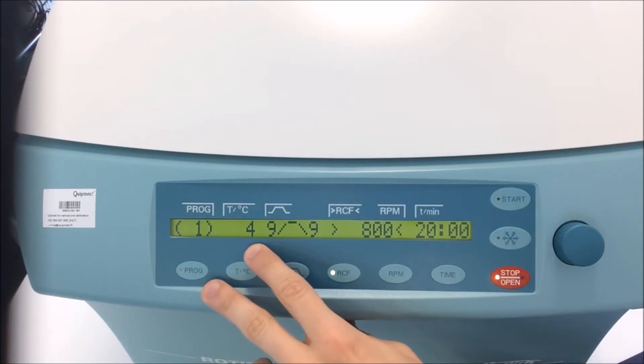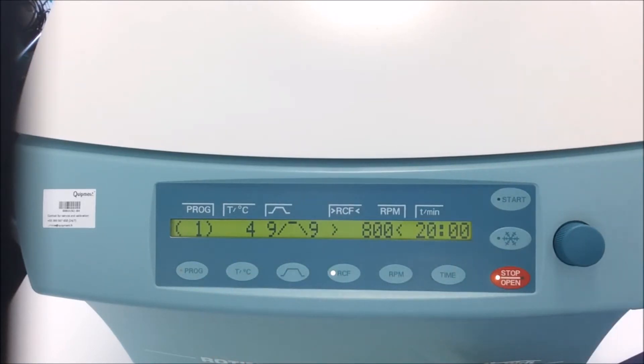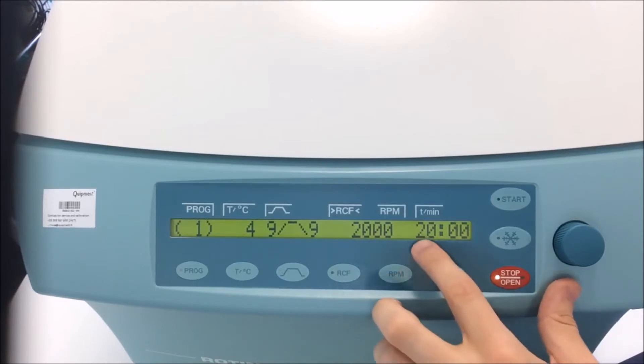Now we have 4 degrees, 9 and 9 for run-down and start-up parameters, 2000 RPM and 20 minutes duration.